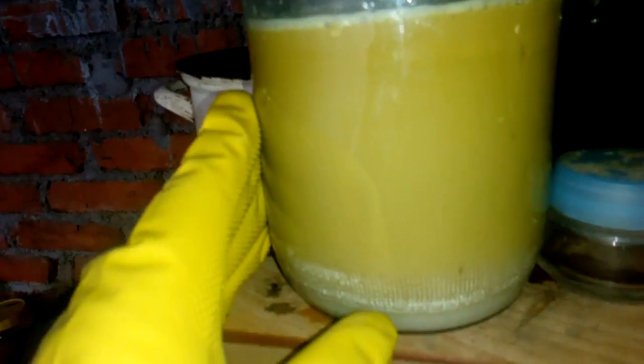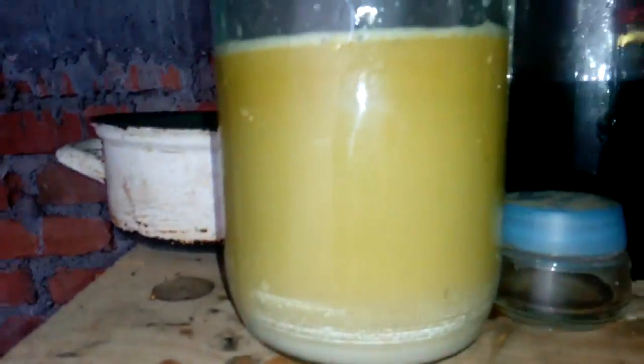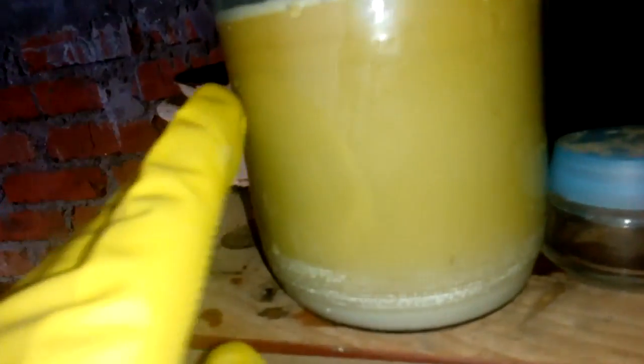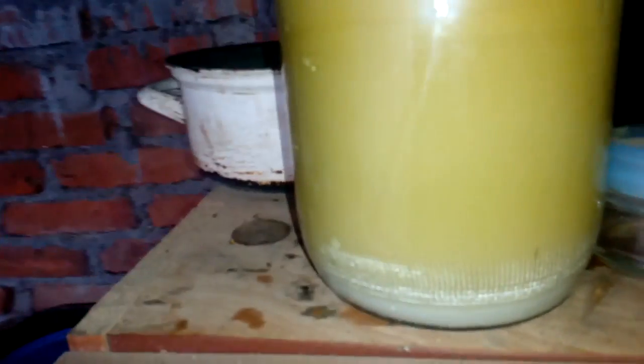Okay guys, so this is our silver chloride inside. And I drop that. So I decant that solution from this MLCCs, this is a filter inside. And what I do, what I'm doing next is I add HCL to drop that silver. And if you see that on the bottom, you already got silver chloride. Now we left that, that settles down. But you see that color is not white, it's got something, some yellow. So I think I got some HCL still in that MLCCs and I dissolve some palladium inside.